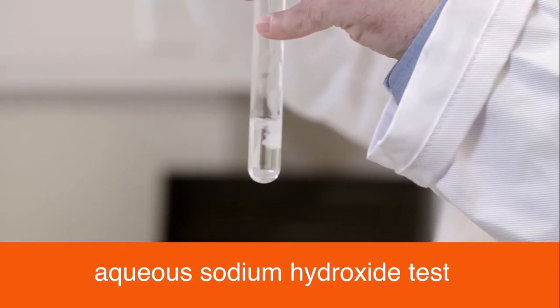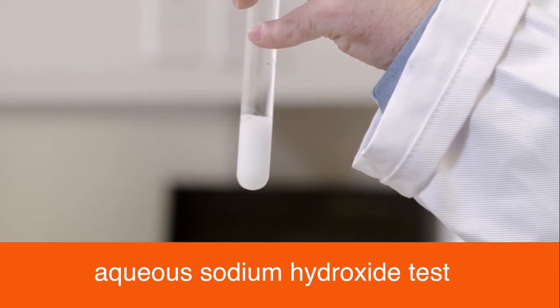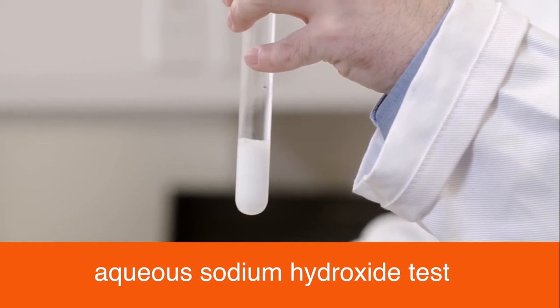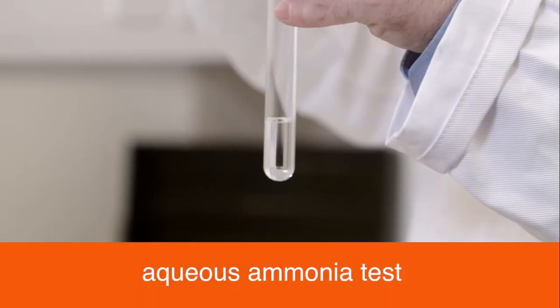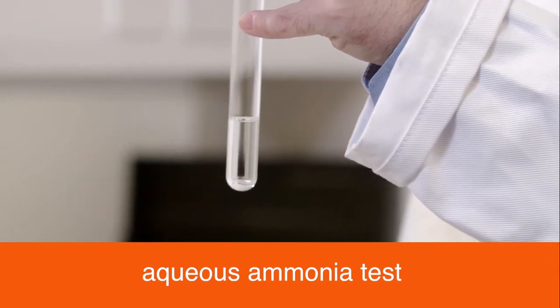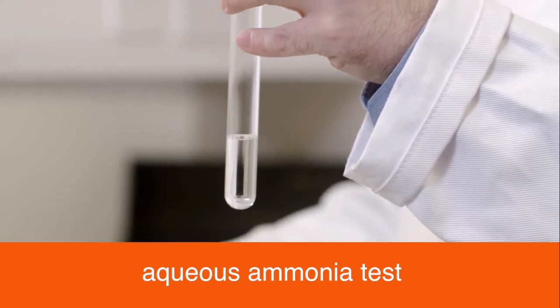A white precipitate is observed for calcium on the addition of aqueous sodium hydroxide. No precipitate should be observed when aqueous ammonia is added. However, a slight precipitate might be observed.